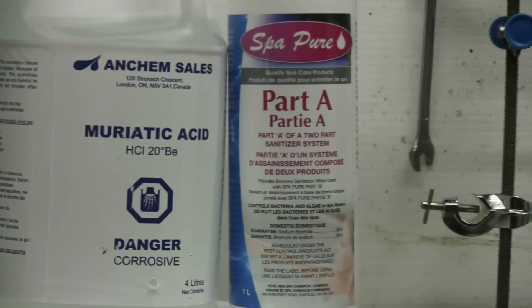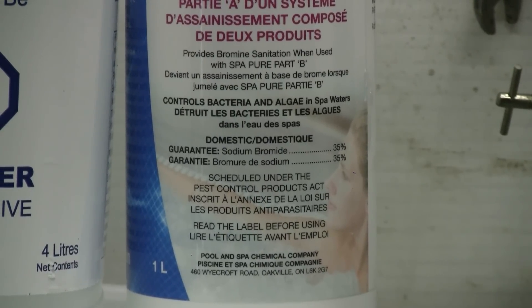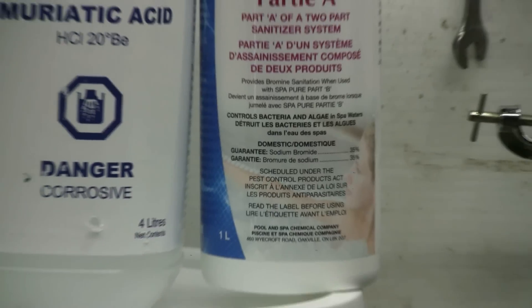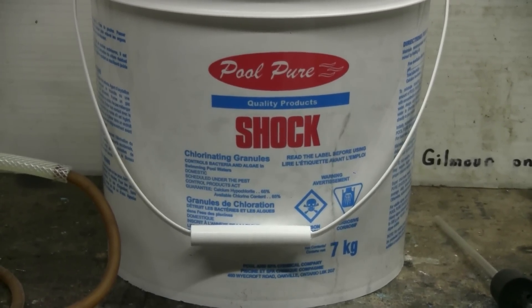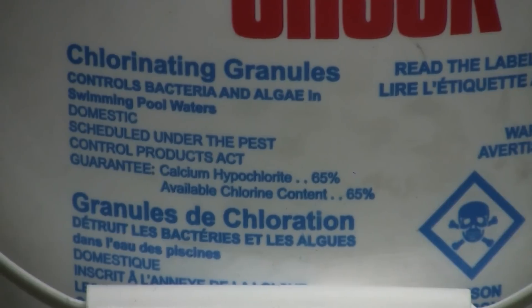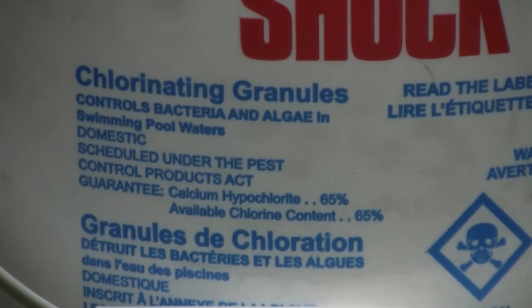Also at the pool store you're going to find this two-part bromine system for spas and swimming pools. This part of it is sodium bromide solution 35% - this will be the source of our bromine. The last thing we need is something called shock, which is chlorine and actually consists of calcium hypochlorite. We're going to use this calcium hypochlorite and the muriatic pool acid to make a chlorine gas generator.